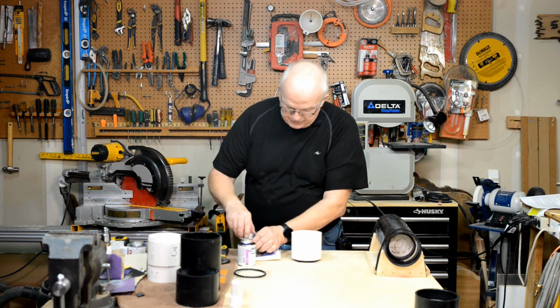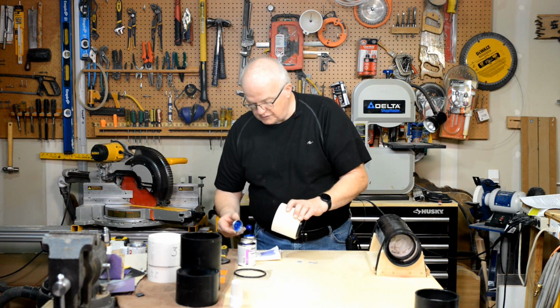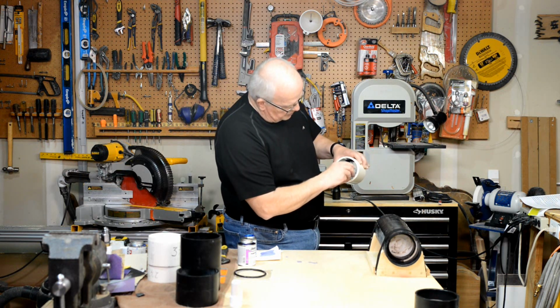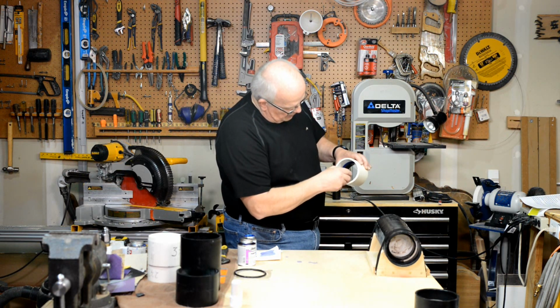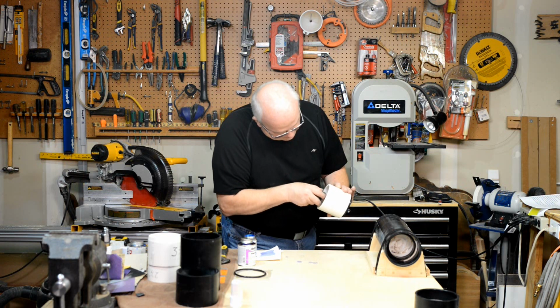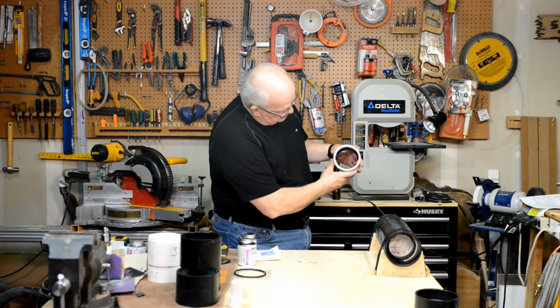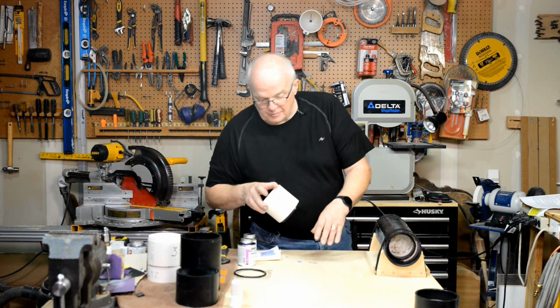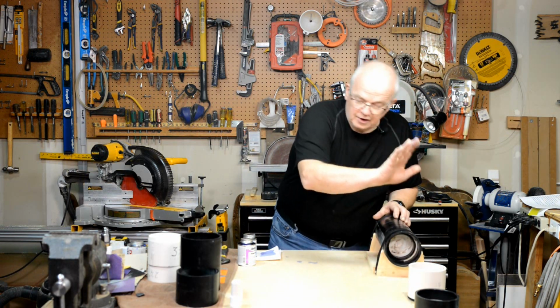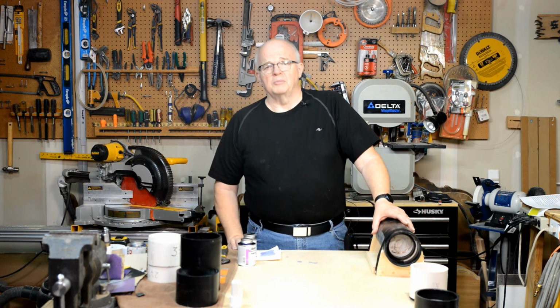So what I do is I will take this, I will put a fairly liberal amount in there. It doesn't matter if you get it all over the place. Well, I mean it does, but inside here. And I want to seal that inside edge, okay? Going to make a nice cap out of that. Okay, there's a nice layer of cement inside of there. Now when I set it up, I'll still set it inside of this. Set it there, and that's good for there. So go ahead and pause here, get to that point, and come on back.